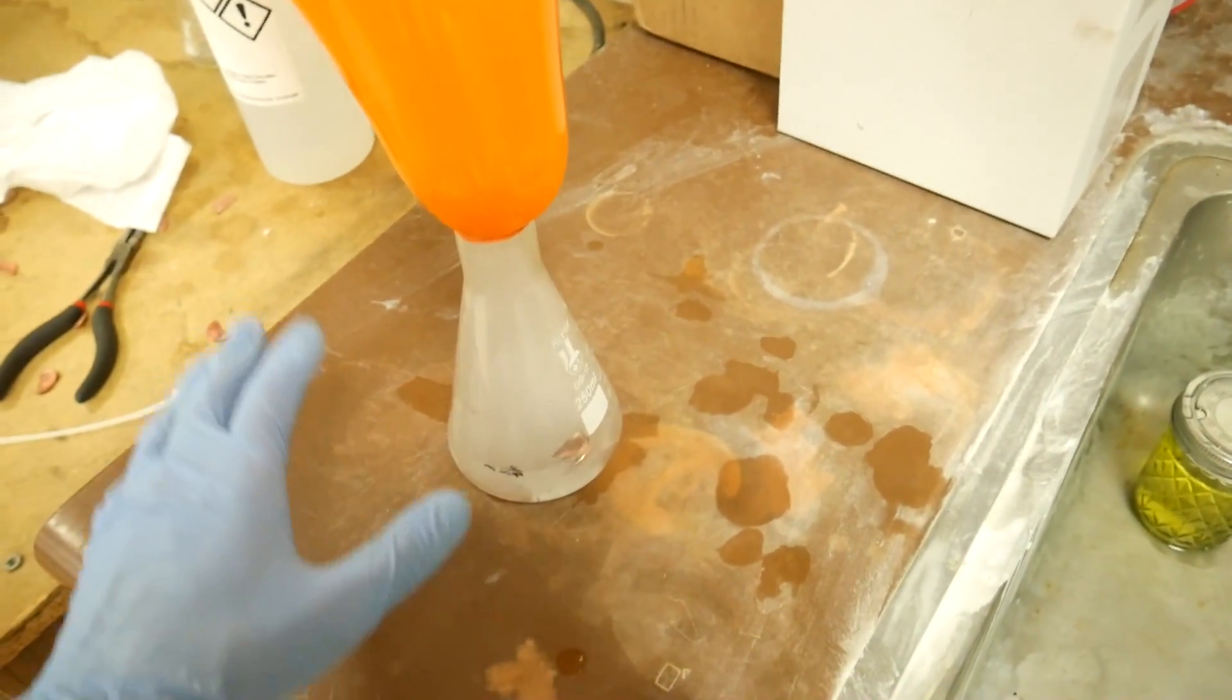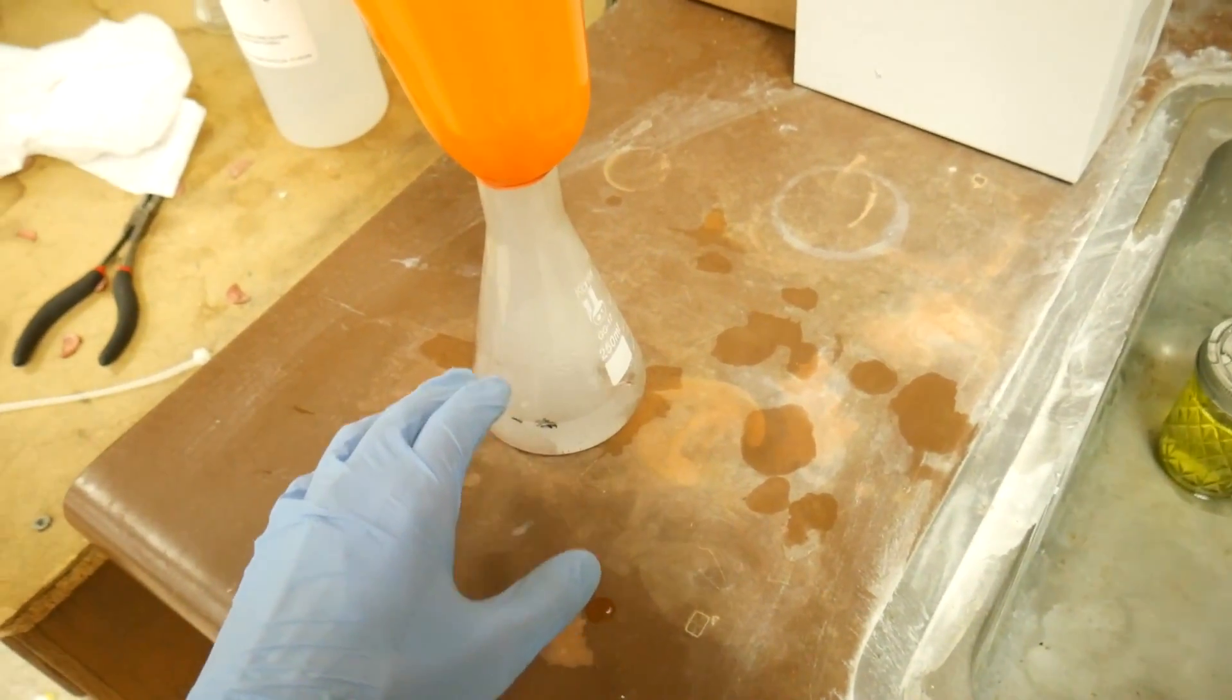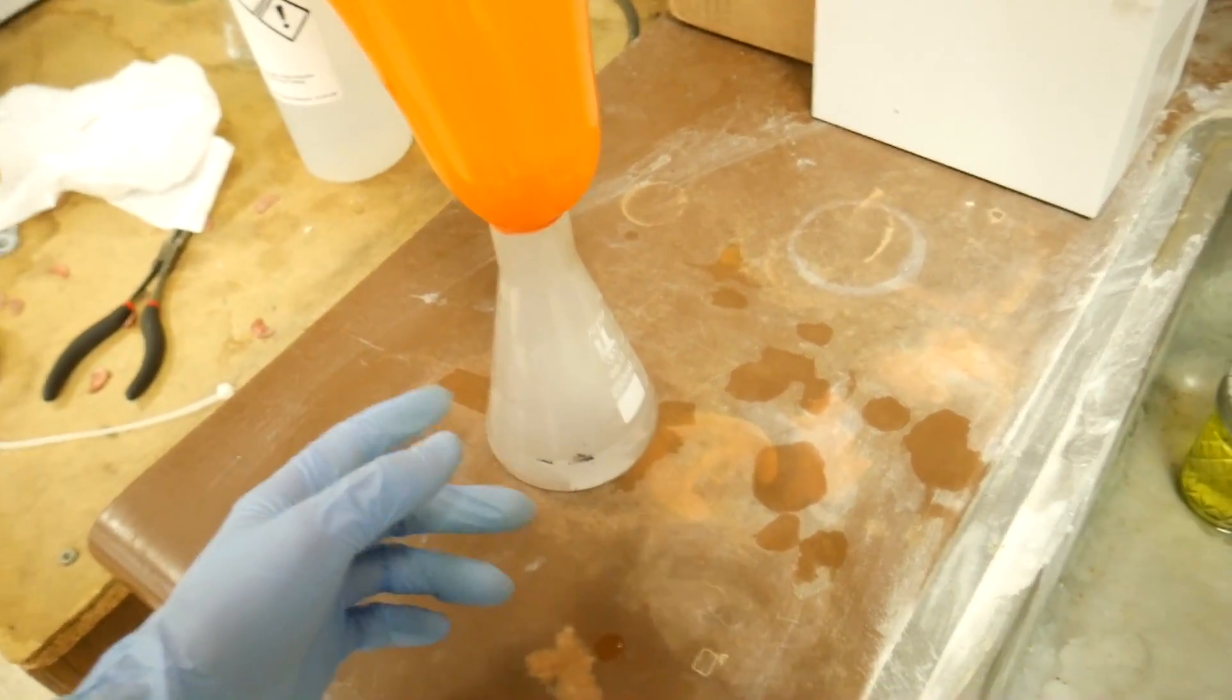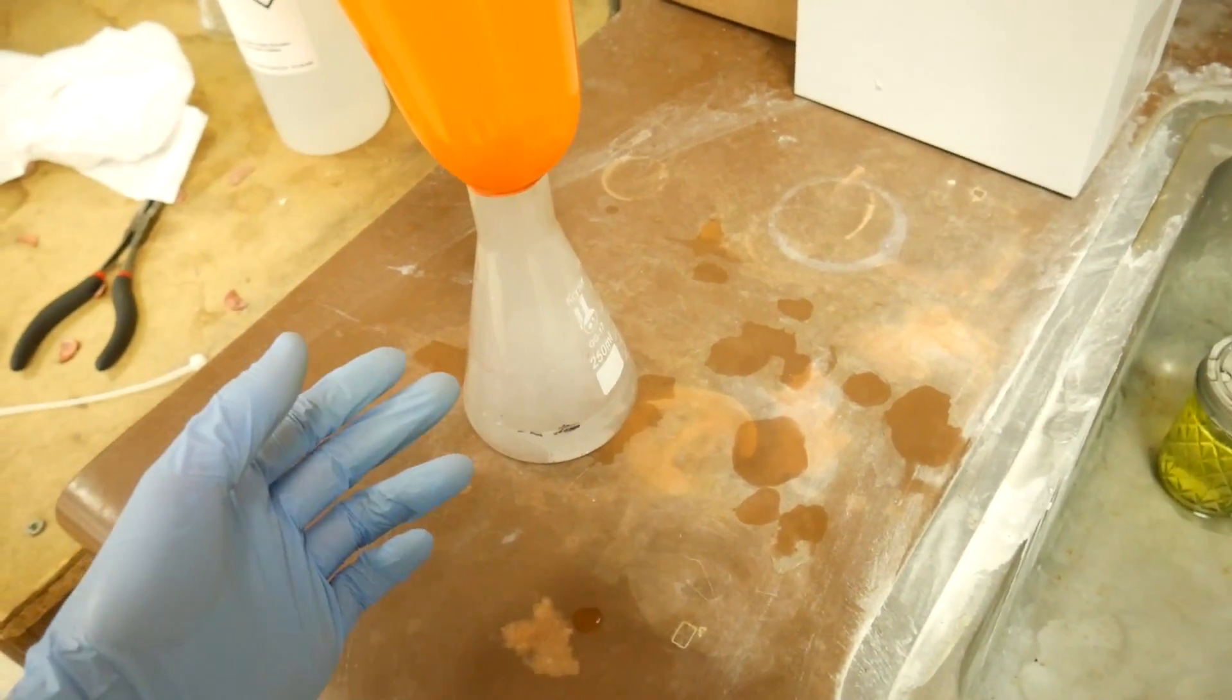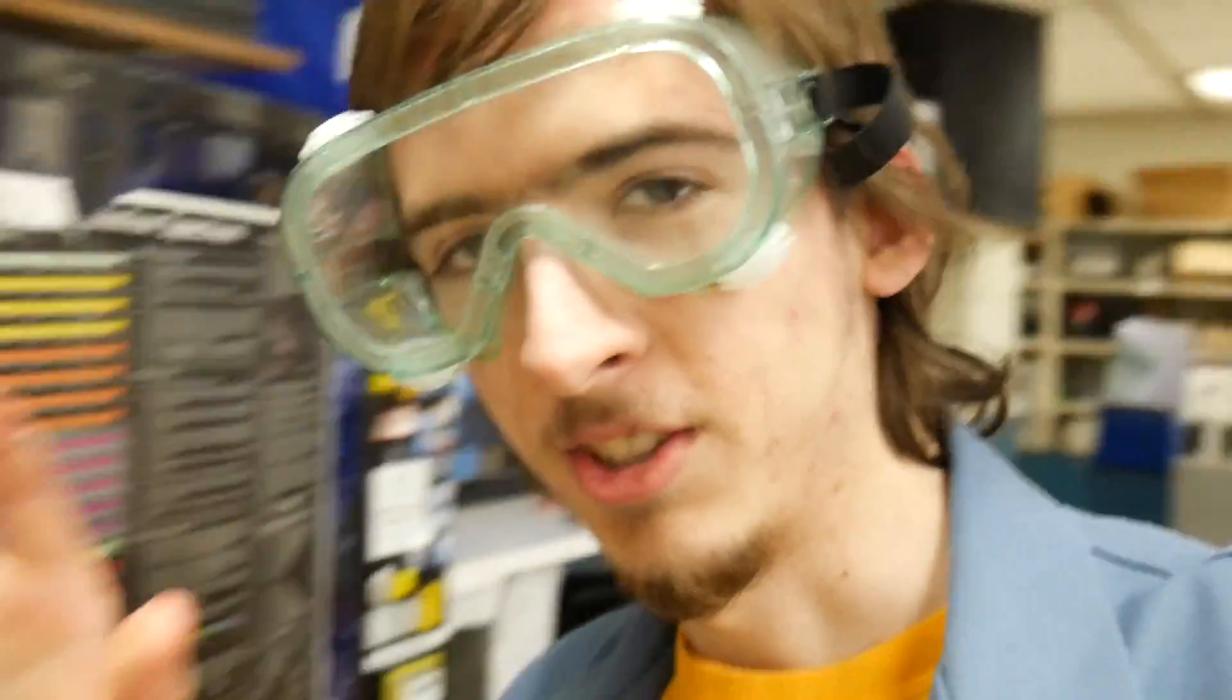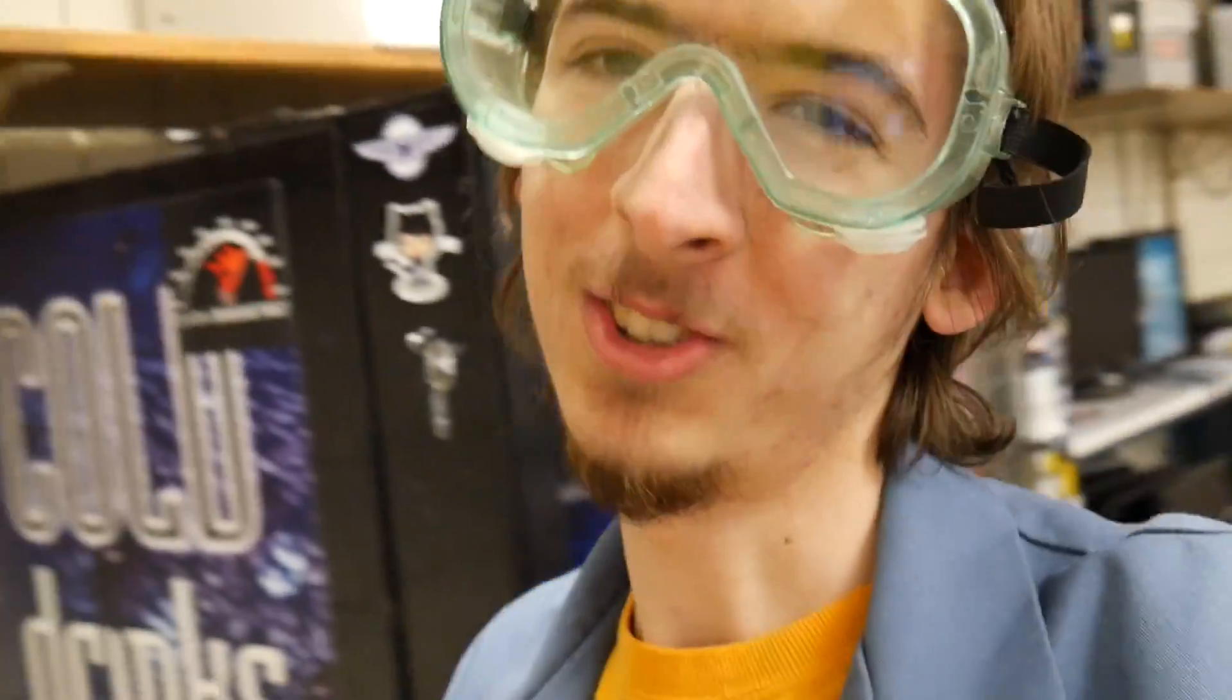Anyway what was I saying? Oh right. Yes. Hydrochloric acid is volatile in and of itself. So it's also always giving off hydrogen chloride HCl gas. And that is also seeping... ow! That's why we take safety precautions. You always have to be prepared for the worst case scenario.